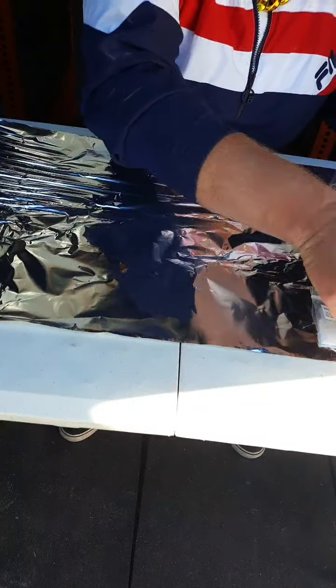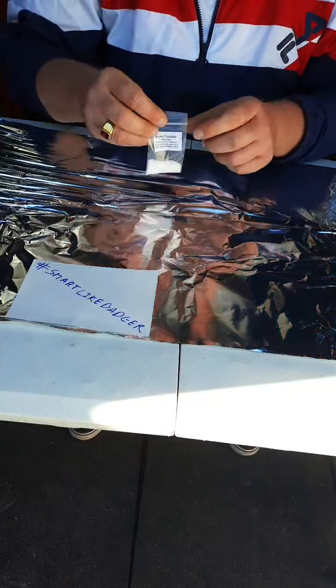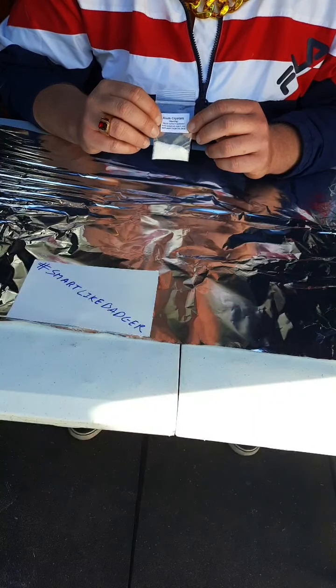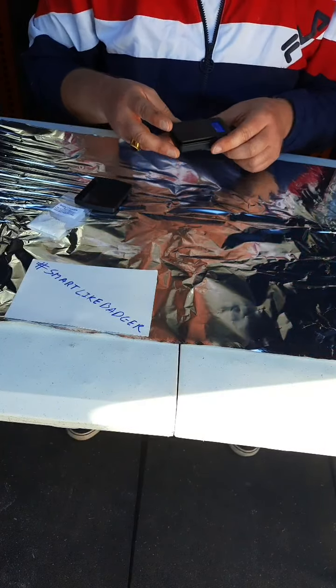We shall do an experiment with alum crystals. Remember that you cannot see the screen, so I don't point at the screen. This is the potassium aluminum sulfate with water molecules, just called alum. These are alum crystals. We only need about 2 grams of this. So we have our little scale that comes in our lab kit. Boris recommends you do not store batteries in there because they wear out.